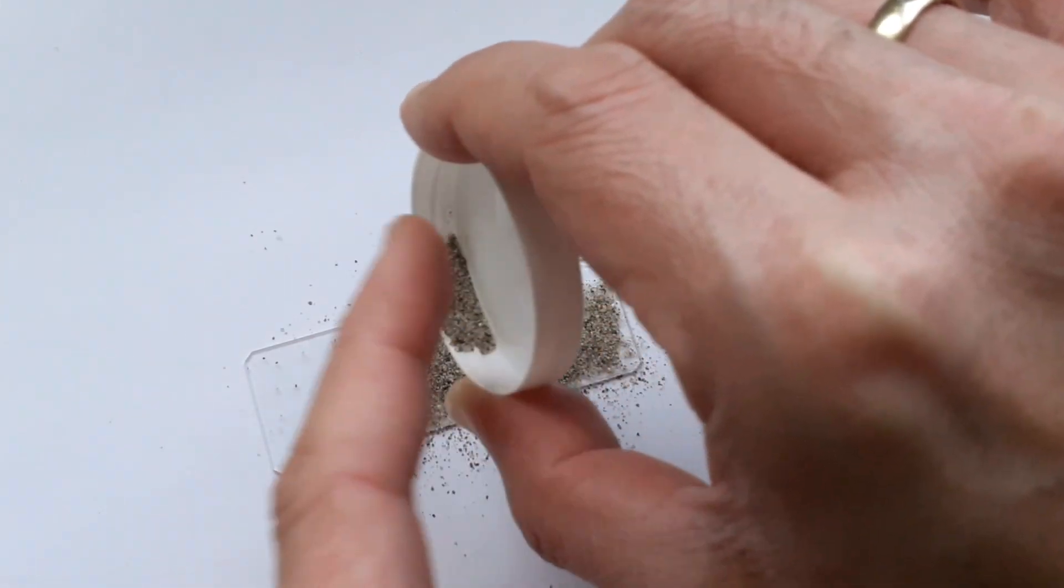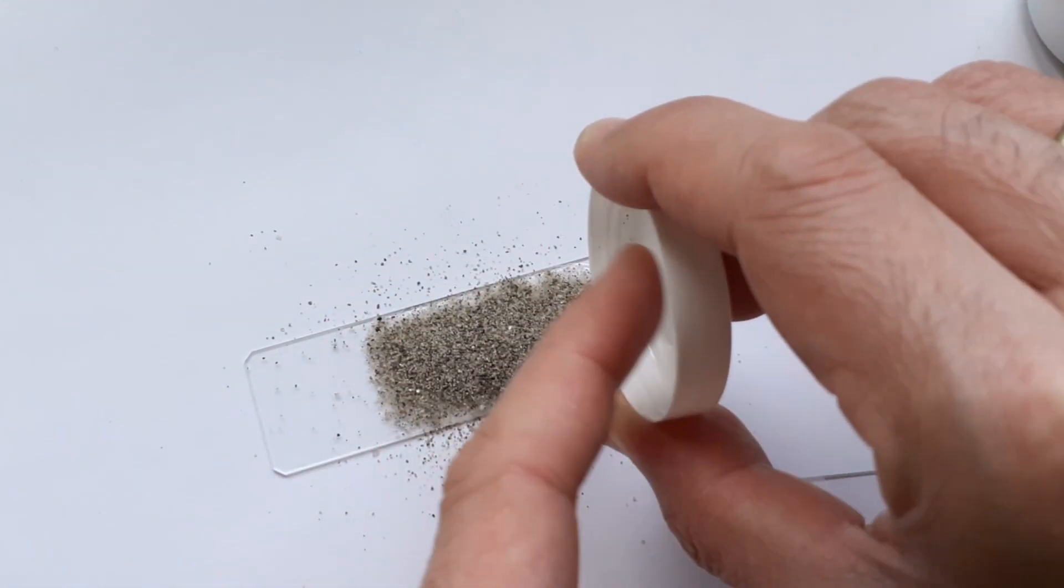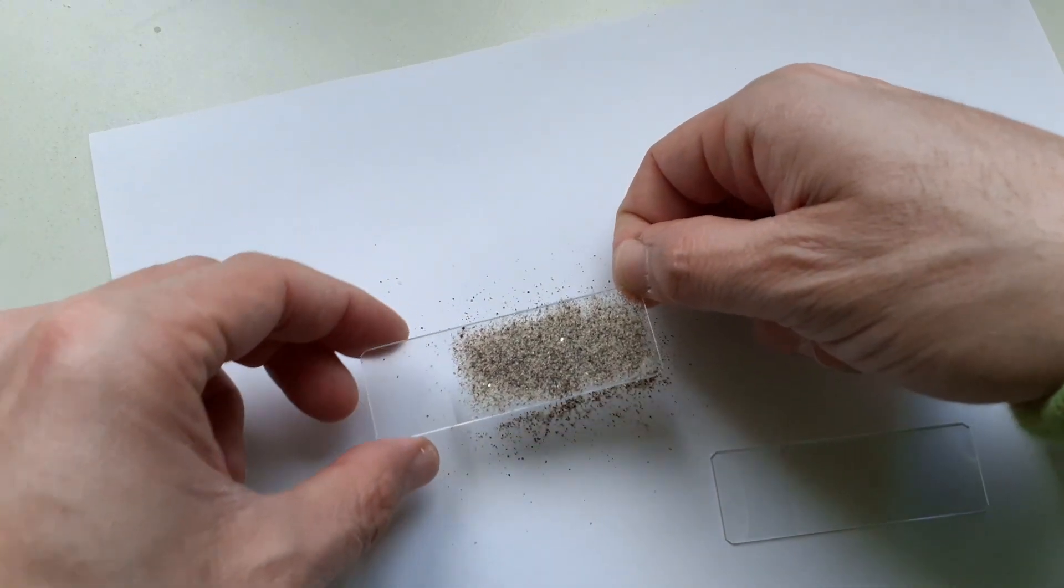Yeah, but that did actually work quite well. The sand was really connected quite well to the slide I have to admit. Actually to my surprise I did not expect this to work that well.